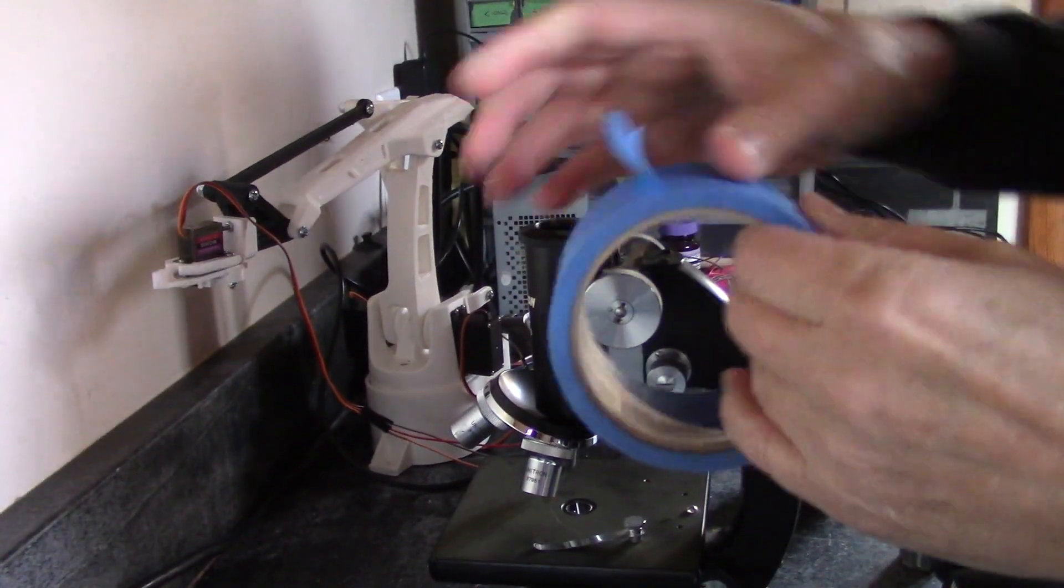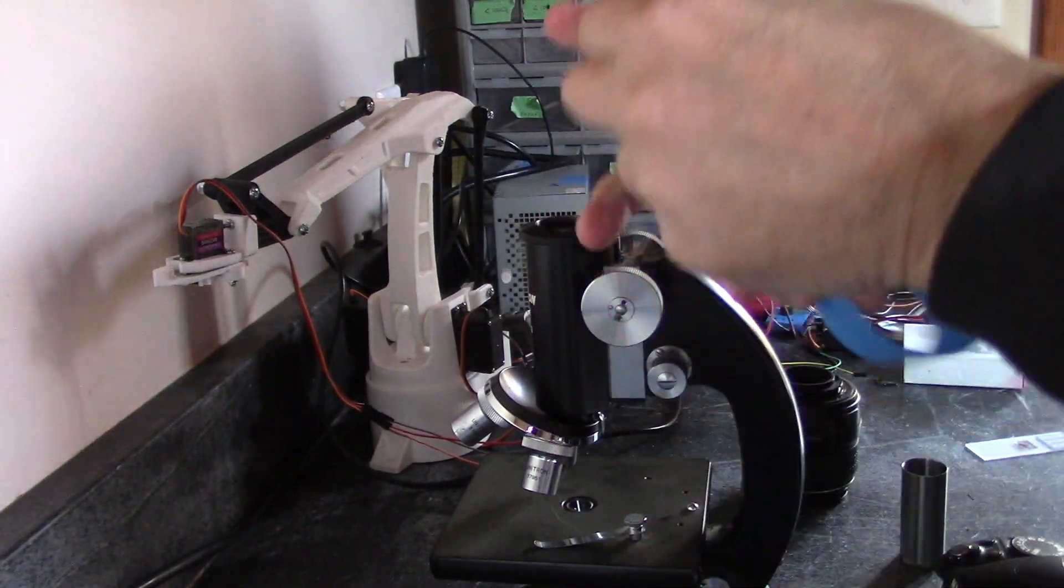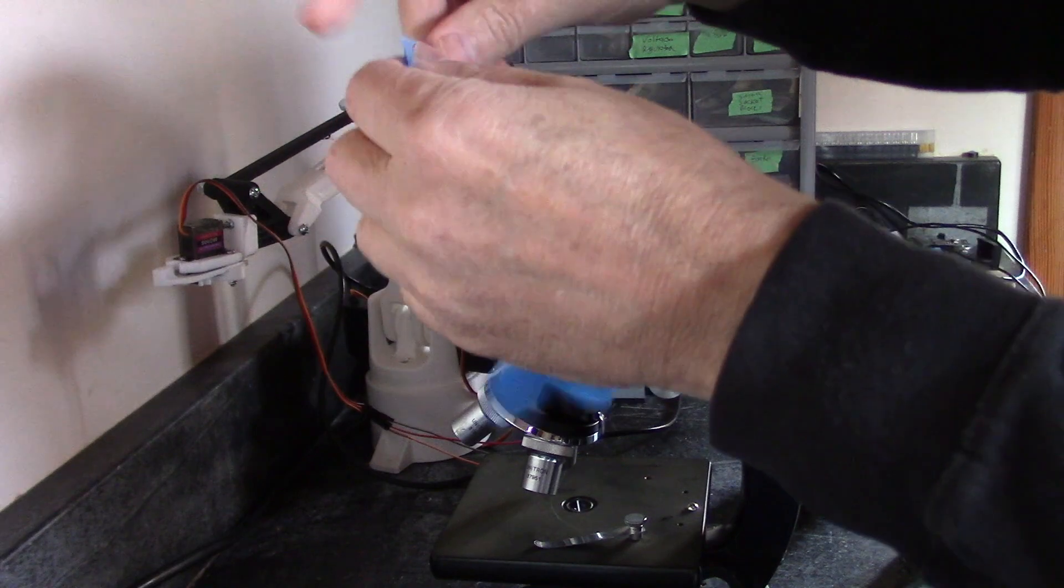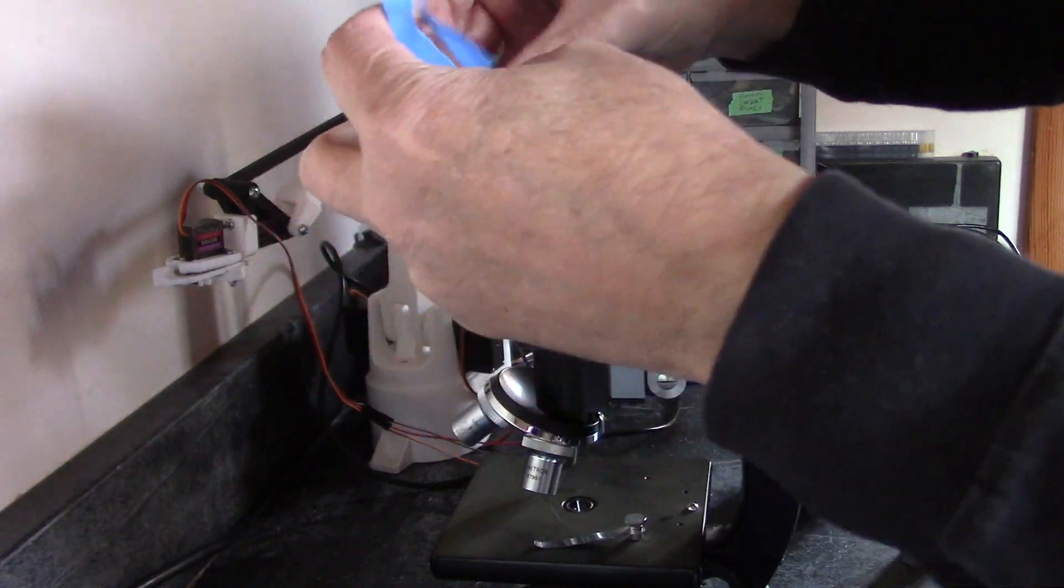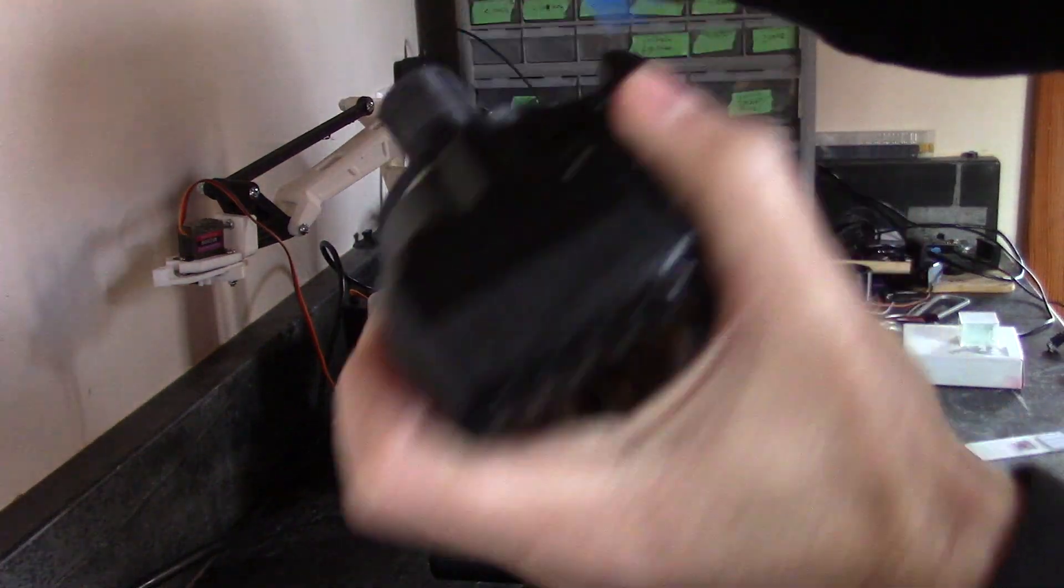Okay, so I'm just going to take some painter's tape and see if I can split it in half. If I can't split it in half, I'll get some scissors and cut it. Yeah, well, I'm going to have to get some scissors. Okay, now let's see if this will work.